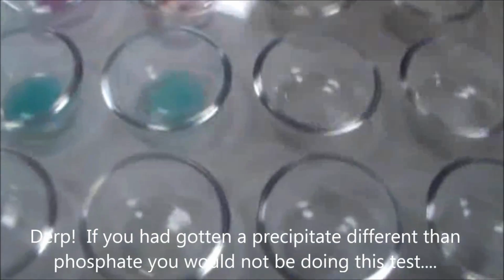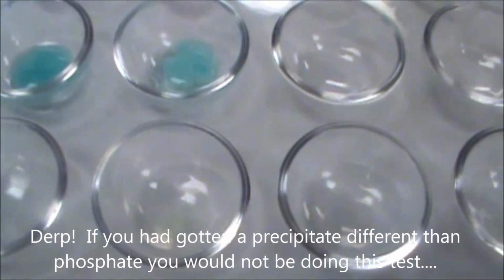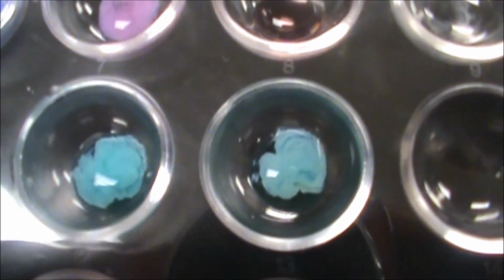So if you just look at that, this one is a little bit lighter, and this one's a little bit darker. We can move that onto here. Okay, but really they look very similar in there too.